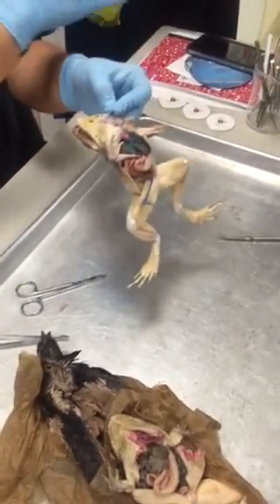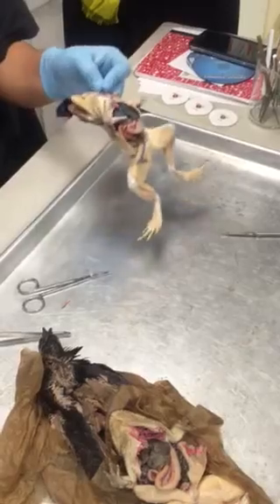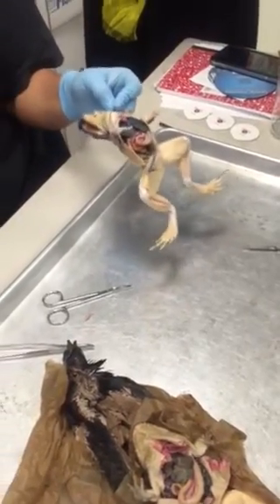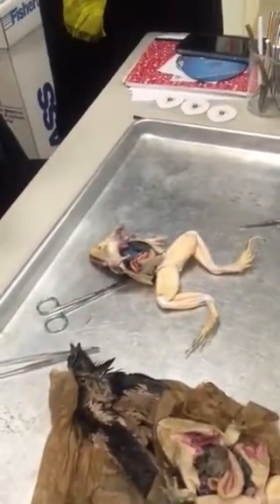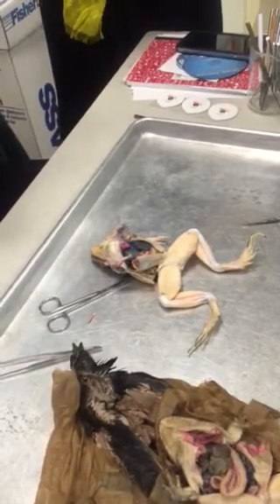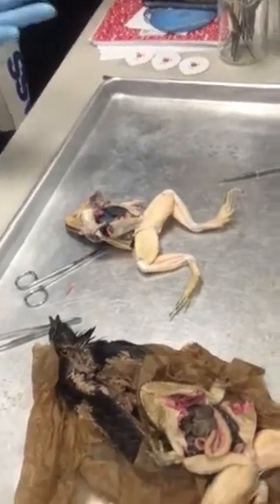And then the branch that goes lateral is called the cutaneous artery, and it goes to the skin. This is where the blood is oxygenated. Okay, so you have the aortic arch, which branches into the carotid arch that has on it the carotid body, the systemic arch, and then the pulmocutaneous arch, which branches into the pulmonary artery and the cutaneous artery.